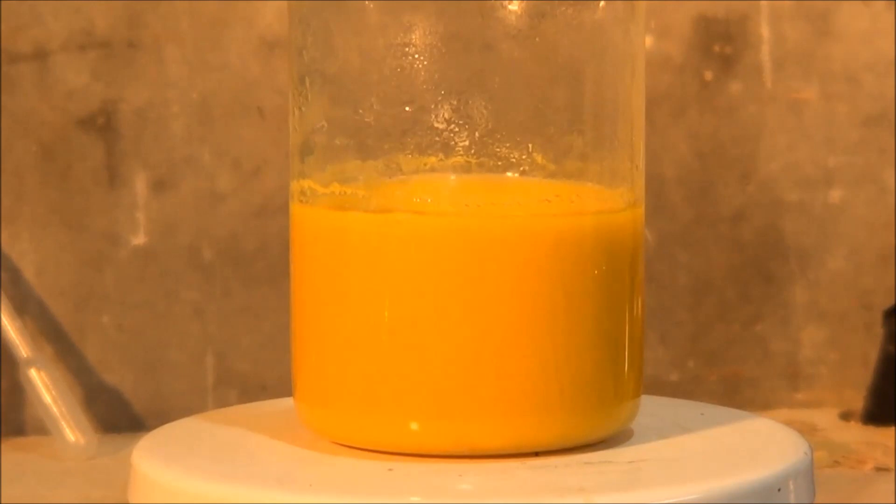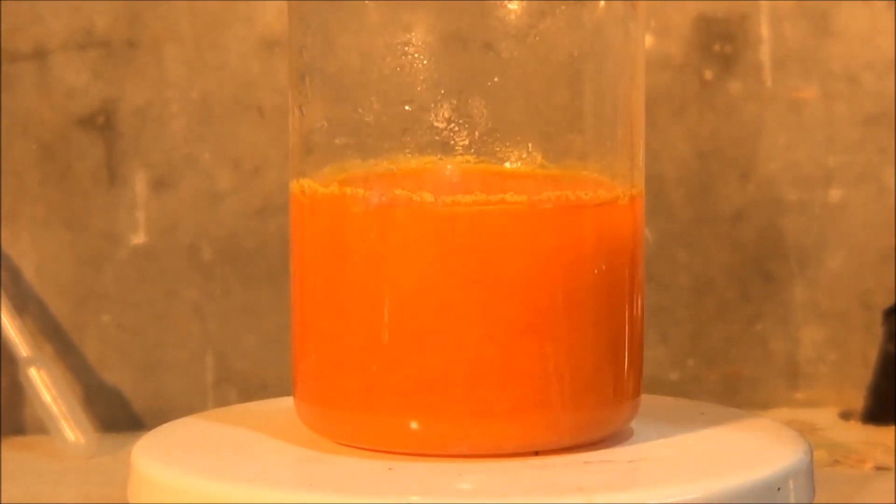So, the dichromate to chromate equilibrium is just a function of pH. So if we get some hydrochloric acid here and add it to our chromate suspension/solution, you can see that it goes orange. So it forms instead the calcium dichromate, and the dichromate is more soluble, so you can see the turbidity of it goes away quite significantly. And it's quite a lovely color change, as per most chromium chemistry - very nice yellows, reds, greens, sometimes blues. Very good, love transition metal chemistry.